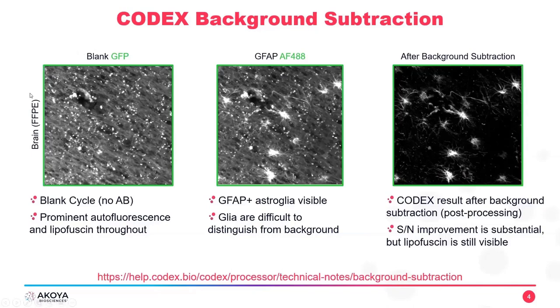In its native state, your tissue is a fixed brain slice that you see here. This is unlabeled, once again, with fluorophores. You can see all kinds of really bright specks and spots on here, as well as some degree of background fluorescence in this brain tissue. That's what raw autofluorescing brain tissue looks like. Again, there are no fluorophores on here. That's just what this tissue looks like after fixation. This is the GFP channel, so this is a low wavelength recording.